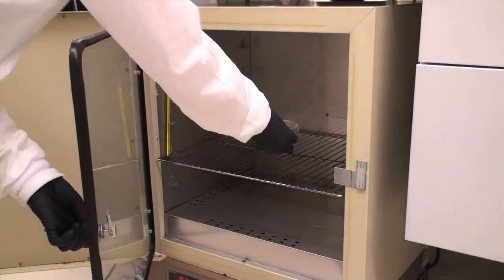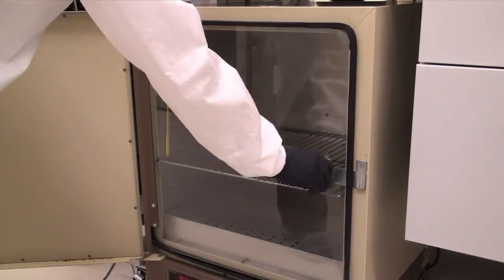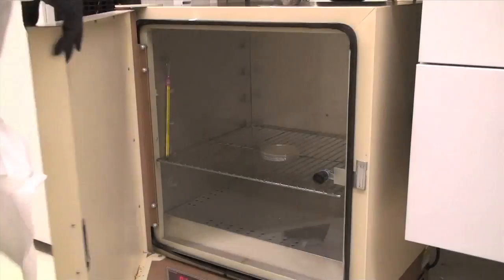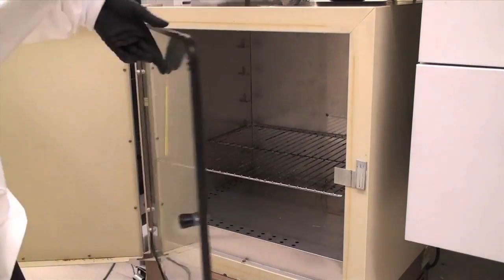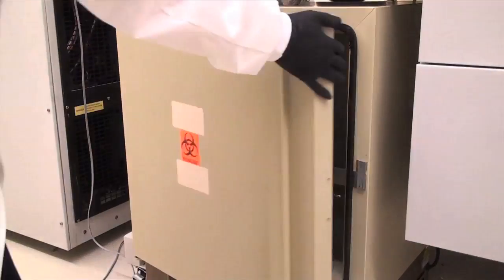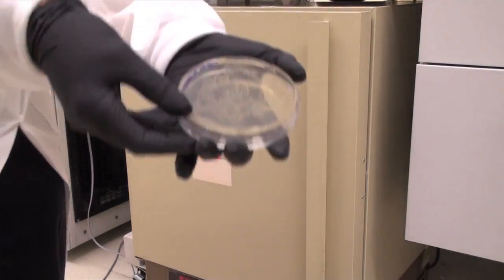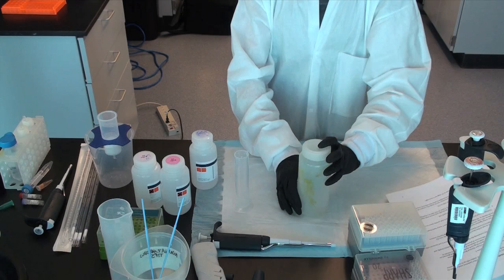Step 14: Invert the plates and incubate at 37 degrees Celsius overnight. Step 15: Add 5 to 10 microliters of 100 milligrams per milliliter ampicillin to 5 to 10 milliliters, respectively, of sterile LB broth at room temperature.